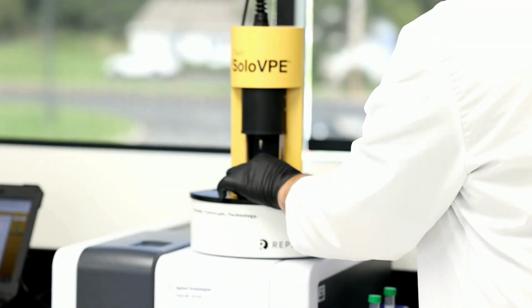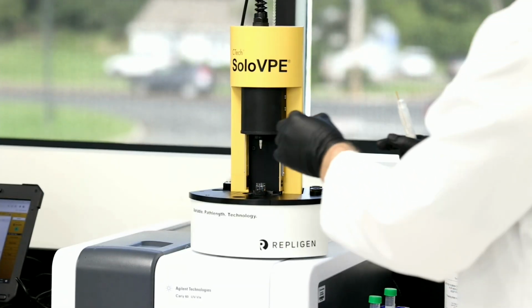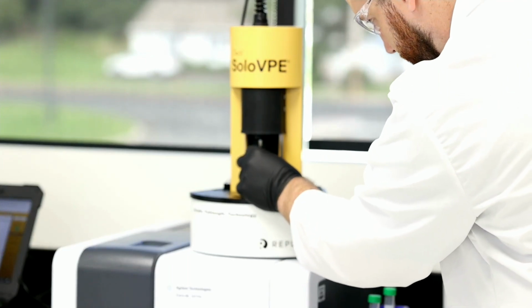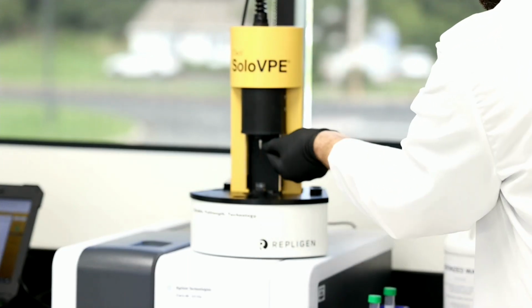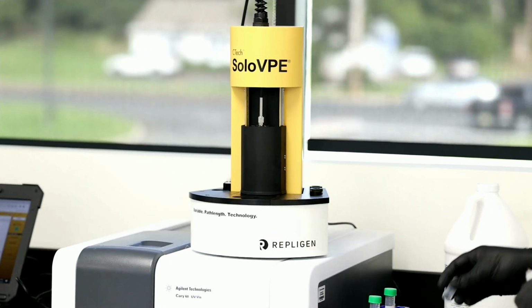So we're going to put our sample in the holder. We're going to get a fibrette. And we're going to insert it here and push up on our silver quickset coupler, lower the stage, and we should be all set. Perfect.